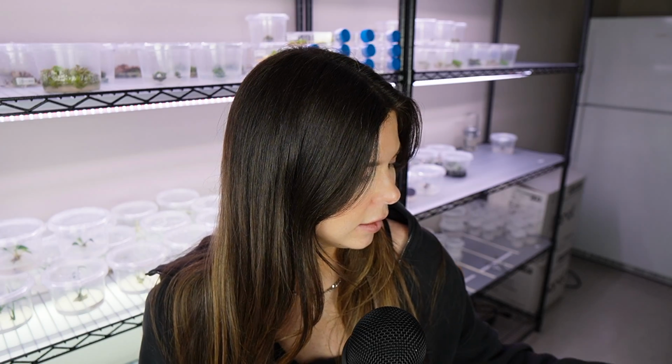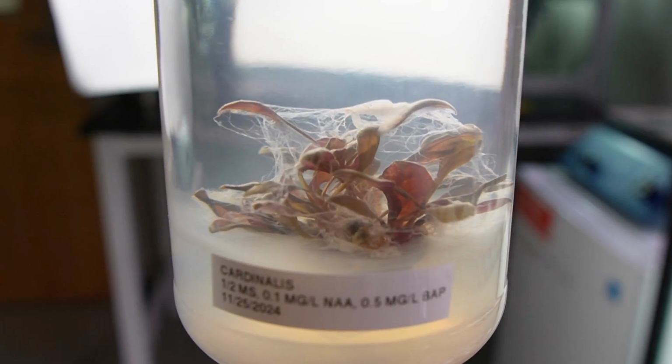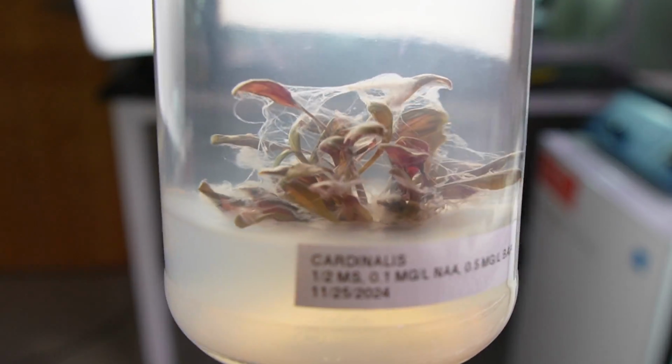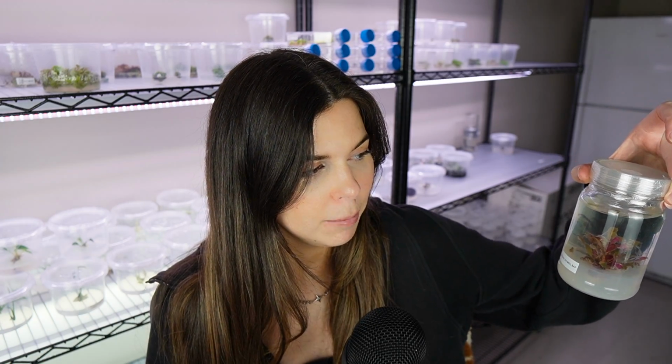In the present day, it has now been 3 weeks since I filmed that lab work. I'm gonna start with the bad news because Lord, there's a lot of it. First, the Cardinalis is contaminated. Mystery slime has taken over completely. To be honest, in the viewfinder, it doesn't look that bad, but I will overlay some footage so you can see how truly nasty it is in there. I'm glad I'm filming this update today, because now I can dispose of this before it becomes sentient.